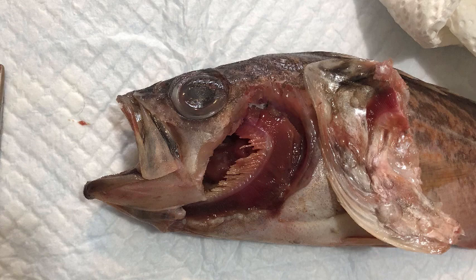Sardines are not in the Scombridae, but they also swim forward continuously as open-water filter feeders. Rockfish, on the other hand, are sit-and-wait predators swimming actively only for short bursts to attack prey or escape predators. You'll notice that there are four free gill arches plus a little one that's attached to the operculum. The sixth arch of bony fish gets modified during embryonic development and serves to supply blood to the swim bladder of the adult fish.